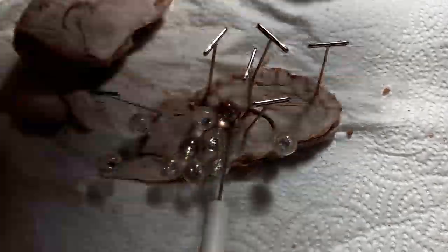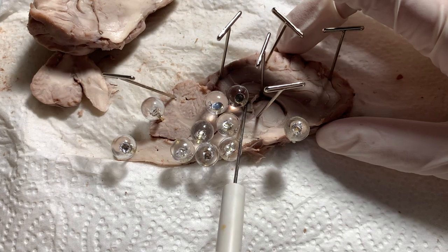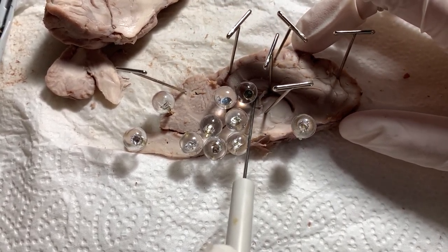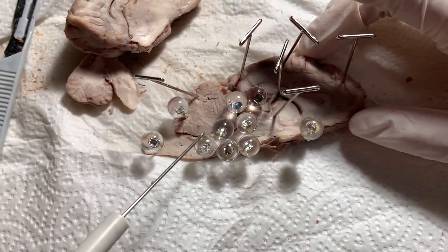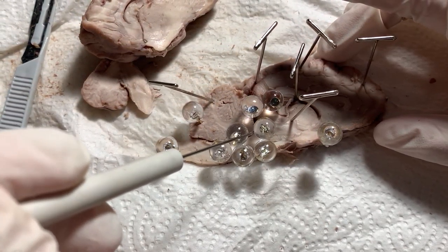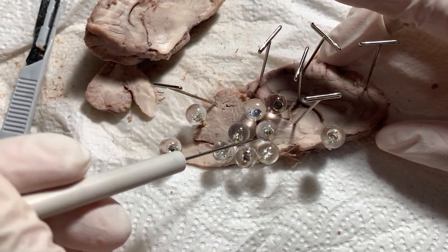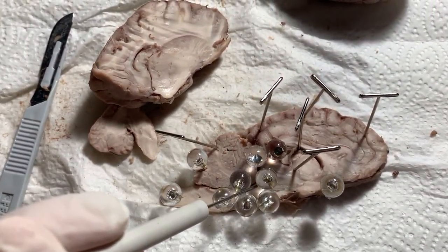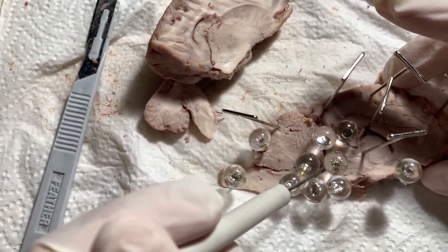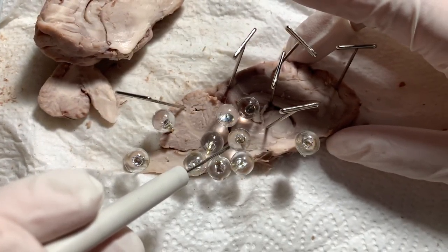Next we have the hippocampus, which is responsible for processing long-term memory and emotional response. Next we have the thalamus, which is in charge of receiving messages from nerve axons and transmitting them to appropriate parts of the brain.